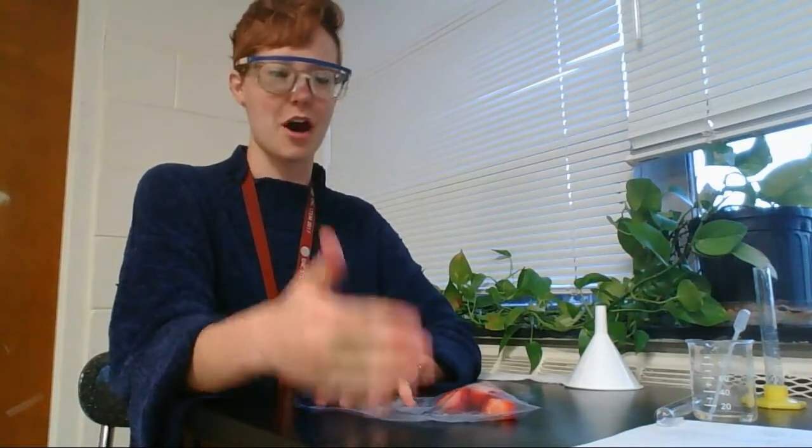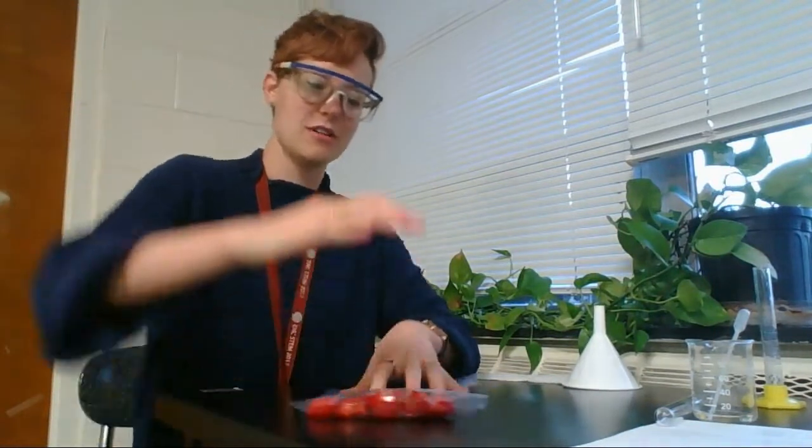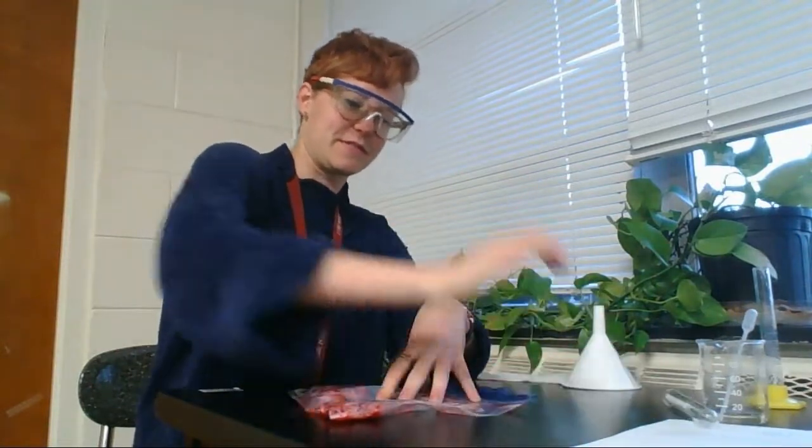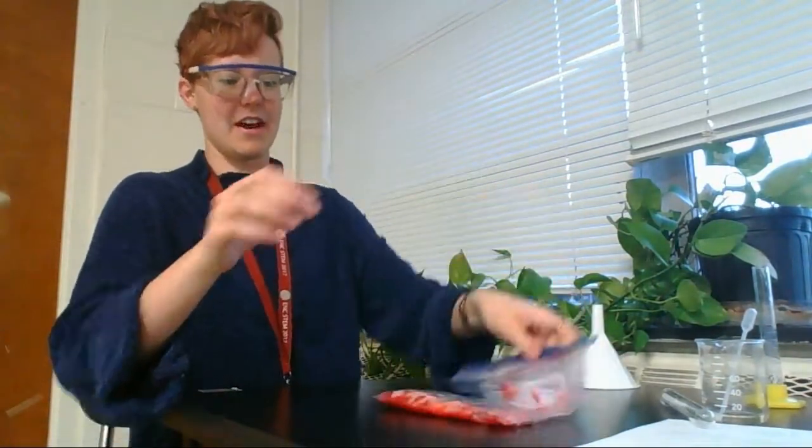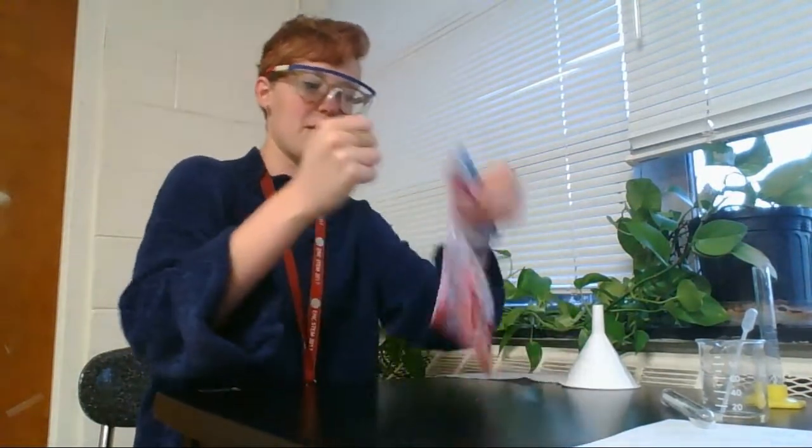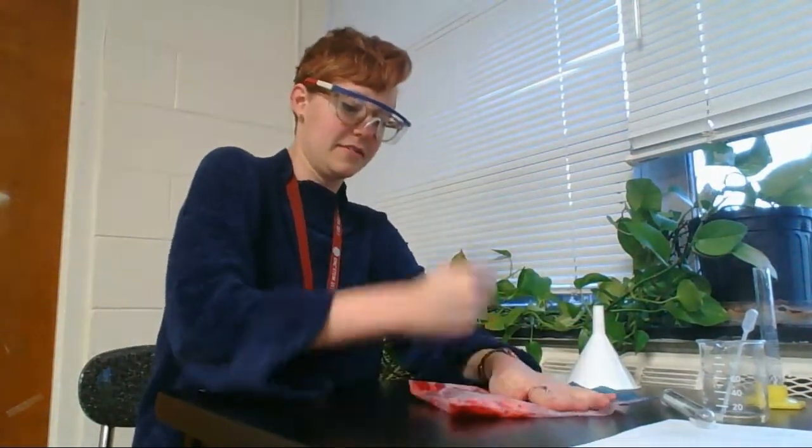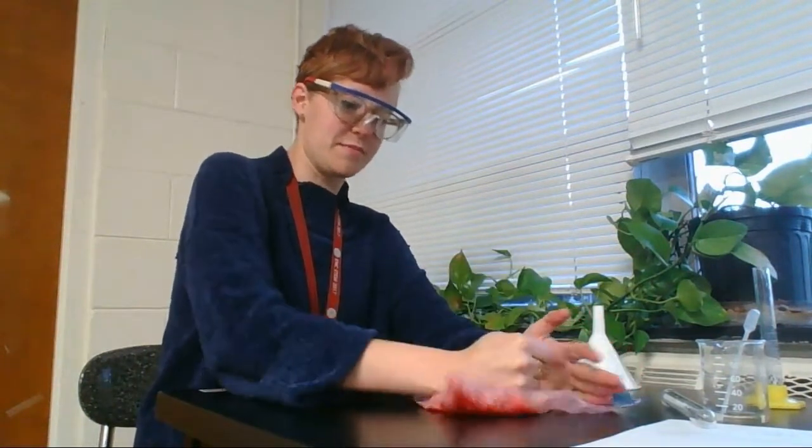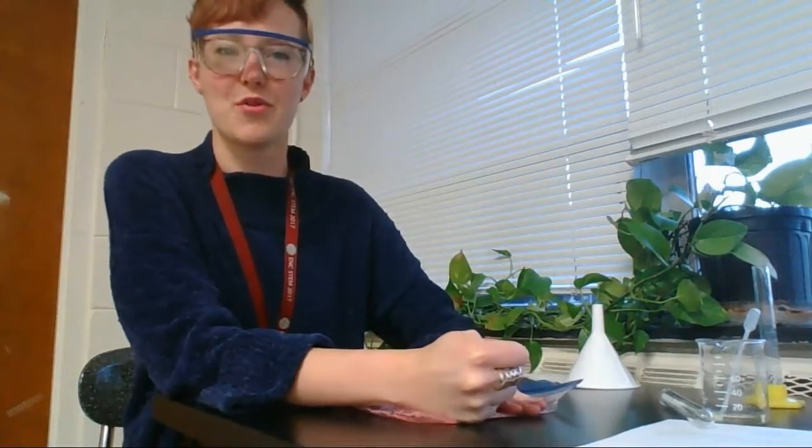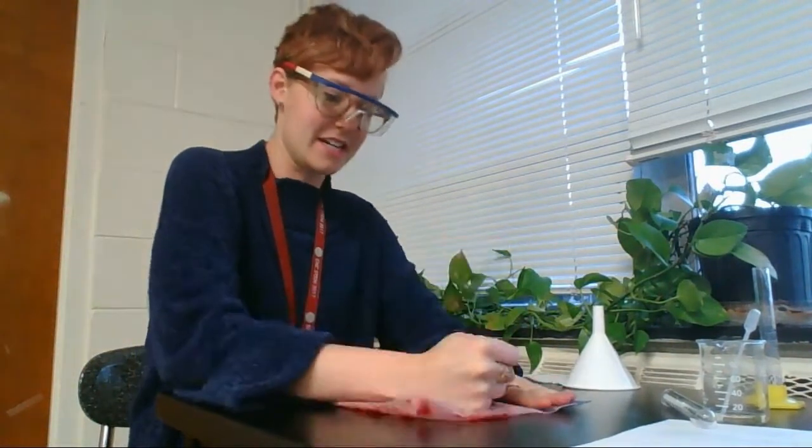Here's the fun part. Here's the messy part. For here, you're going to take like a couple minutes and you're going to smash your strawberries. So whatever anger you have inside of you, go ahead and get it out now. You want to smash your strawberries as much as you possibly can. This is why it's very important to make sure your Ziploc bag is sealed tightly.